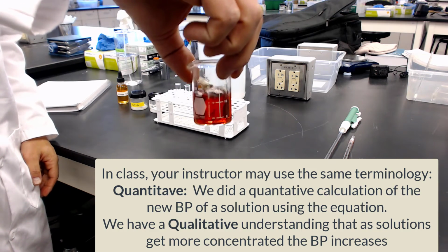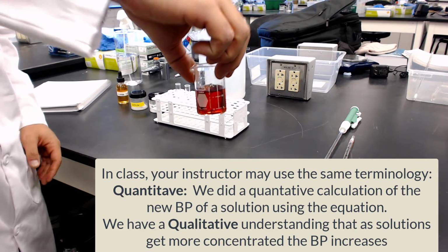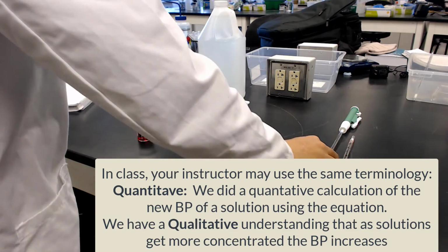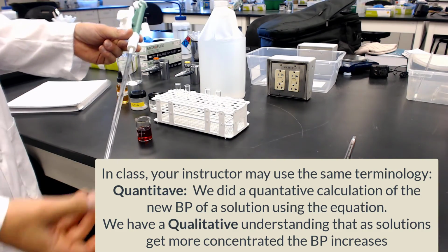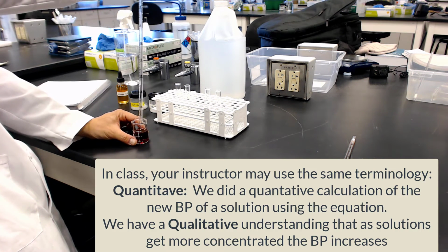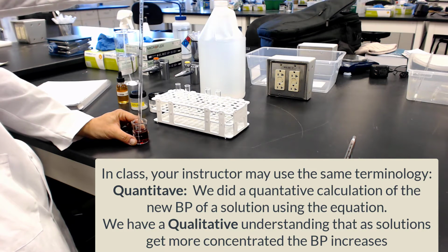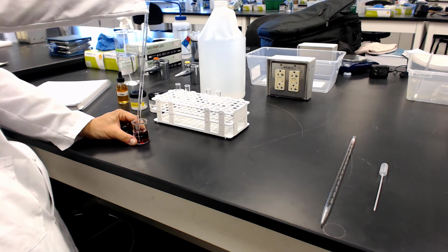And so this is going to be the equilibrium color. So he's going to split this into tubes. One of the tubes is going to remain untouched, so it can be our reference color. And then the other ones are going to be the ones that we actually do the chemistry on. So we look at the procedure. We're going to distribute equal amounts amongst the 4 test tubes. So we're running about 5 mils a piece into each tube.